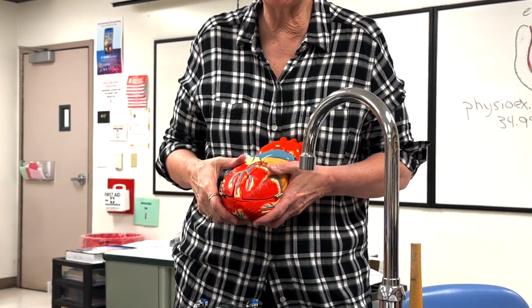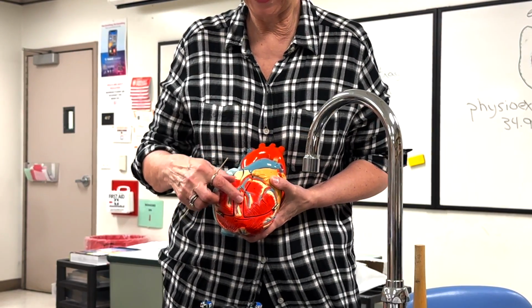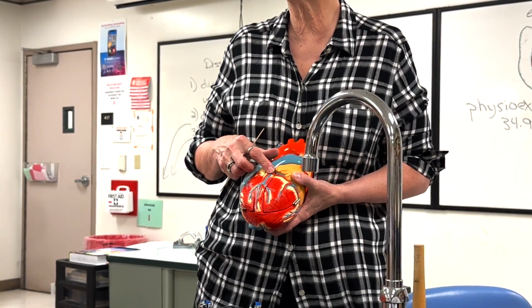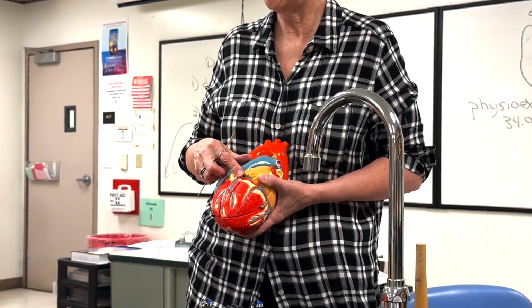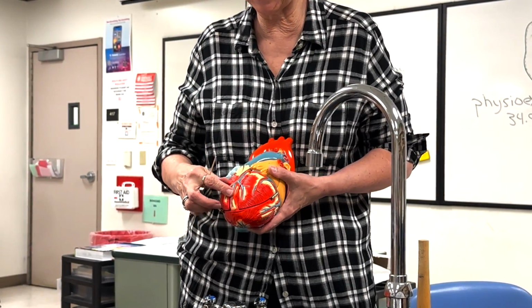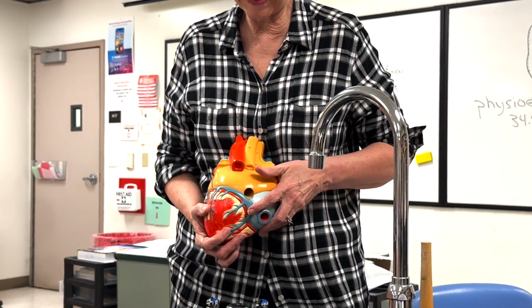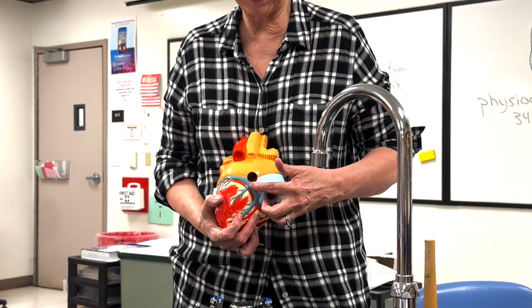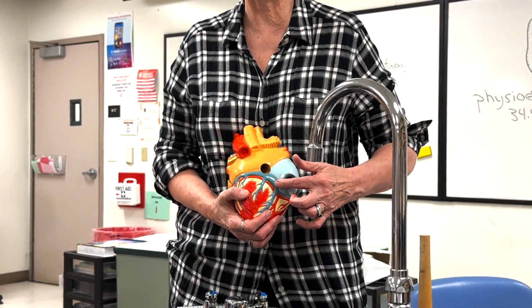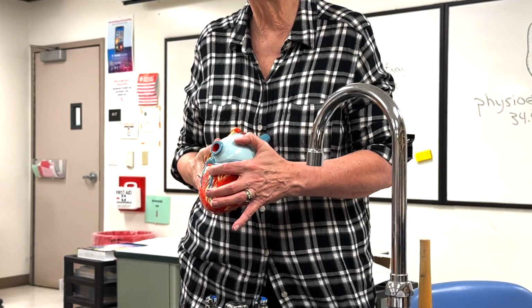So we talked about the coronary sinus. It starts here with the anterior interventricular artery as the great cardiac vein. Some textbooks will call it the anterior interventricular, but then it changes names and we might as well just stick with one. So we have 3 cardiac veins. The great starts at the front, then we find it with the circumflex, and then finally it dilates under the left atrium to the right atrium where it empties into the heart as the coronary sinus. The other 2 veins empty into it right here.